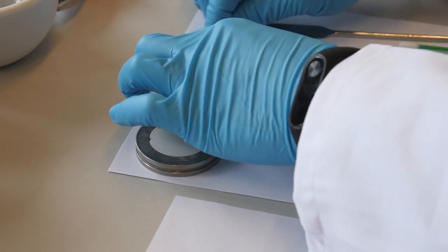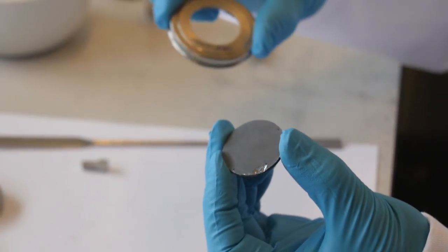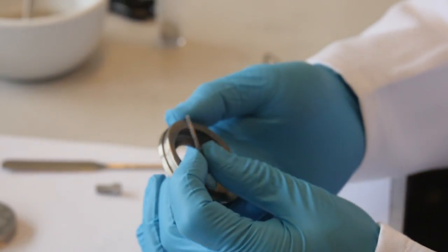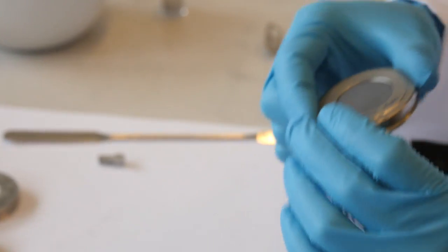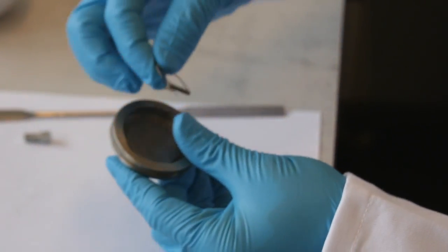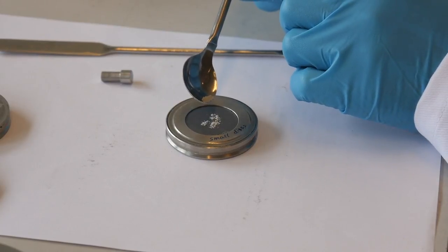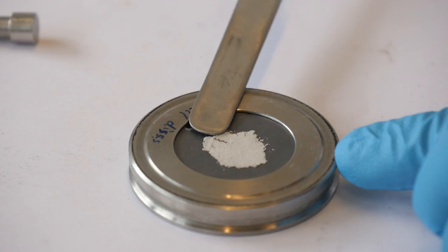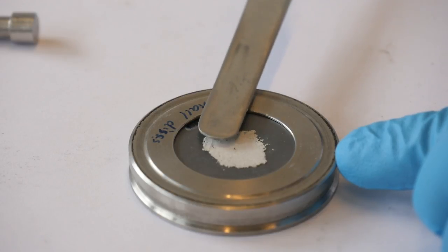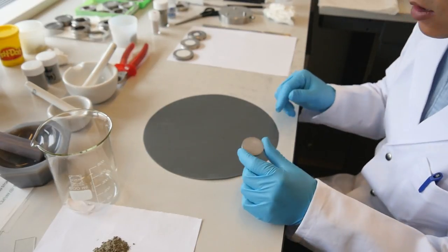When there are not enough samples to fill the cavity of the sample holder, the so-called zero background sample holder can be used to support a limited amount of sample. First, fix a zero background slice to the sample holder. Spread the tiny amount of sample on the disk and try to make a smooth surface if possible.